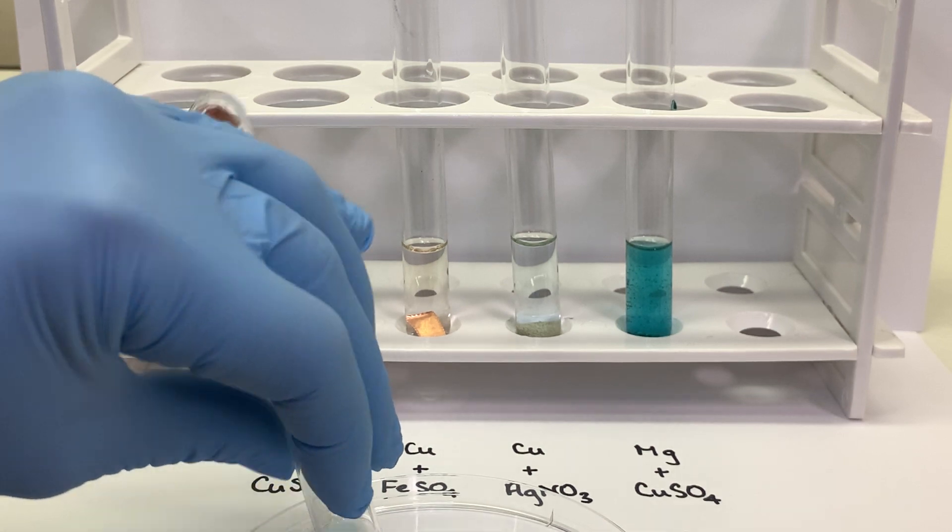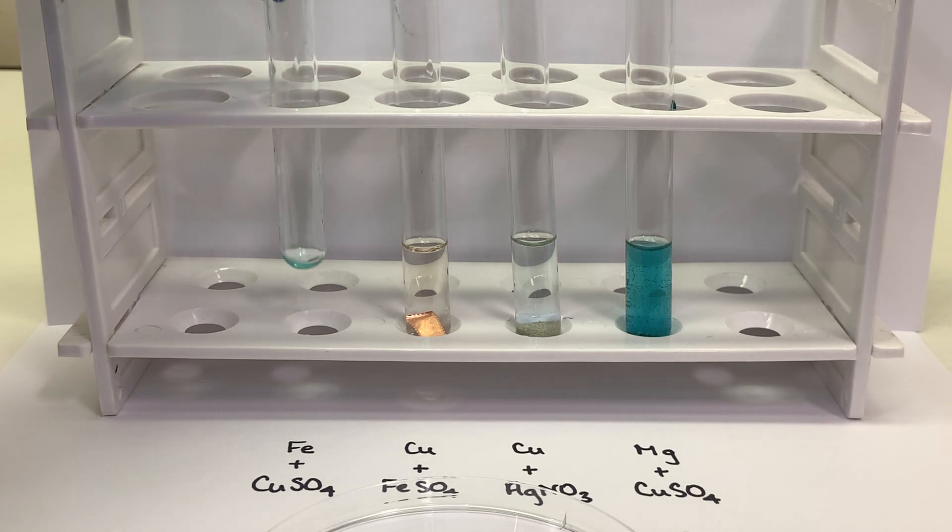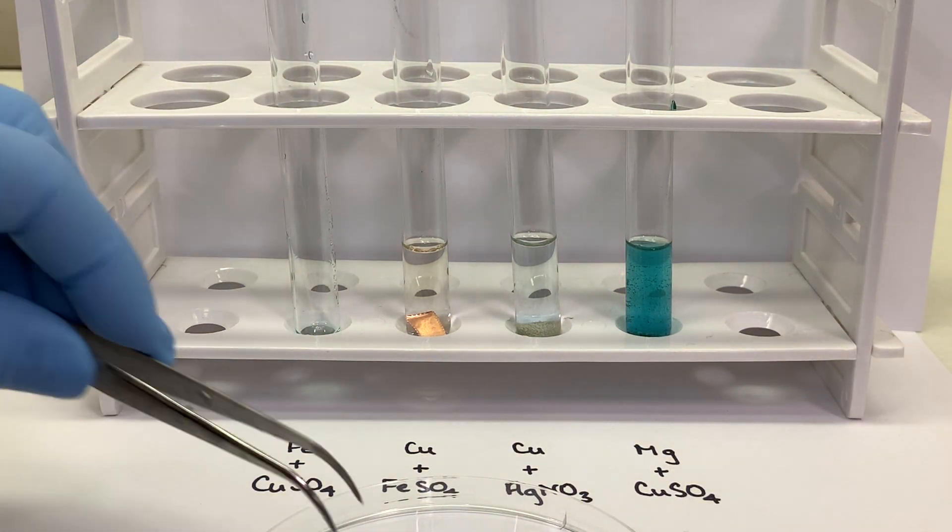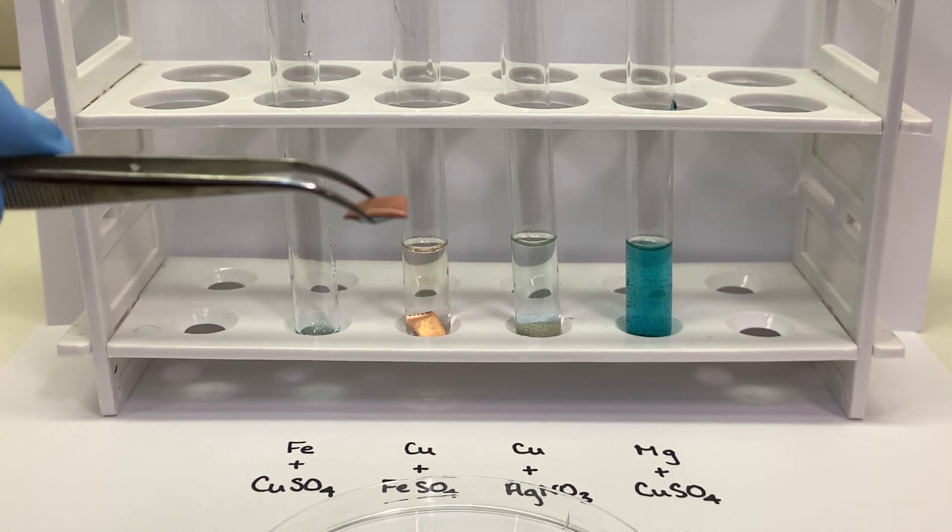So the first reaction was iron and a copper 2 sulfate solution. Those were our reactants. And here is one of our products.